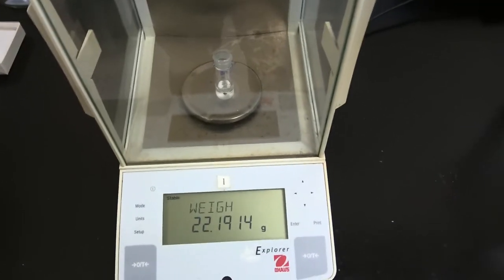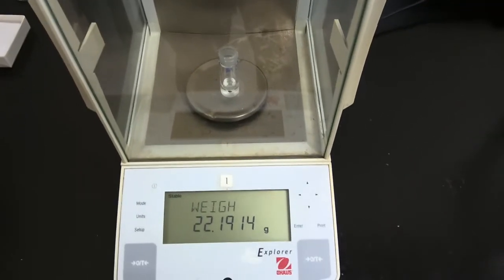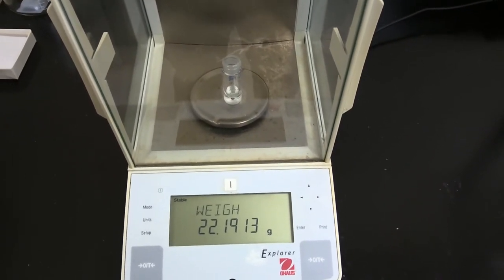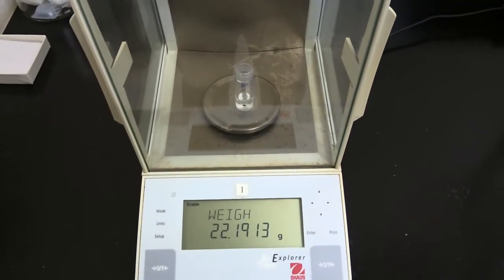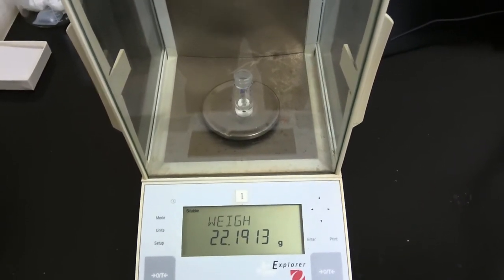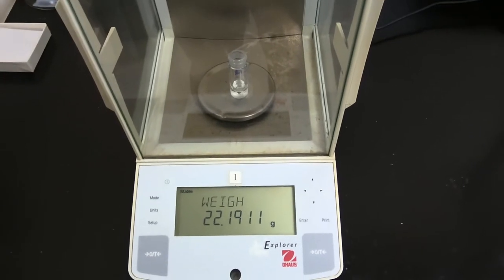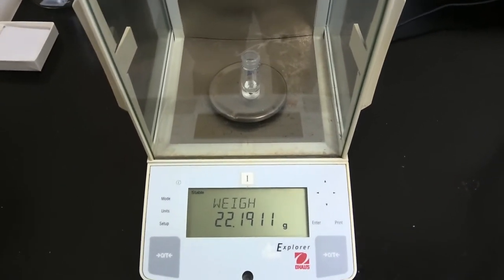We're now going to move on, and we're going to take an IR, and we're also going to take a proton NMR of our product. We're also going to perform a series of chemical tests, and the IR, NMR, and chemical test observations will be provided on Canvas.